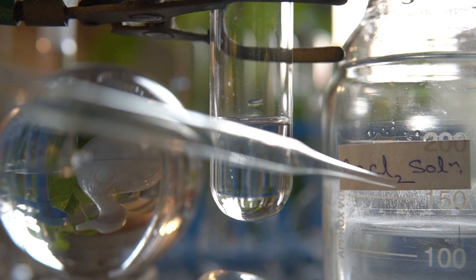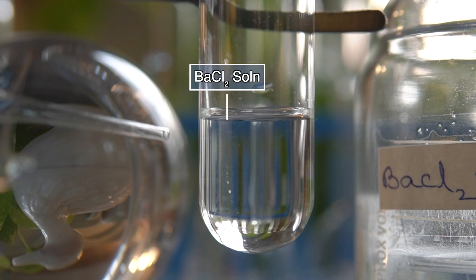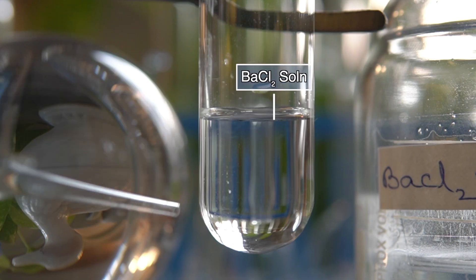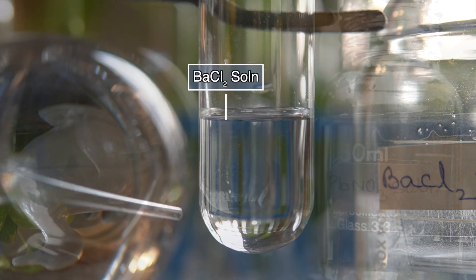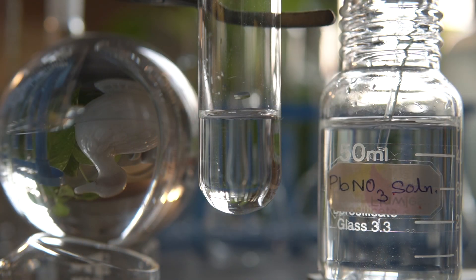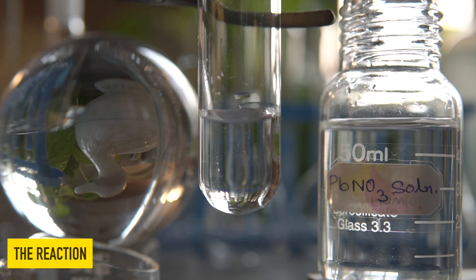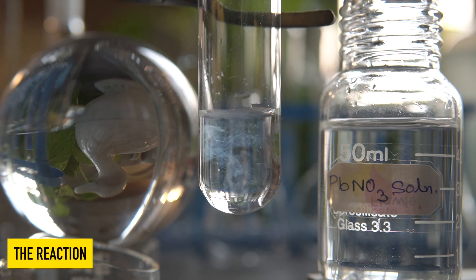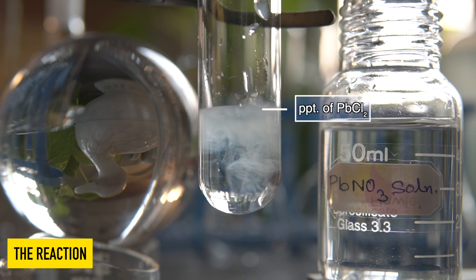To initiate the reaction, we will take some amount of barium chloride into this test tube. Now we will add lead nitrate solution slowly into the barium chloride solution and observe the effect.